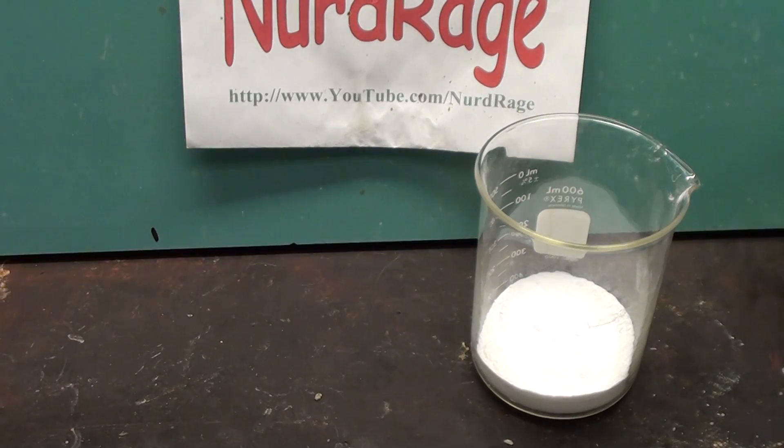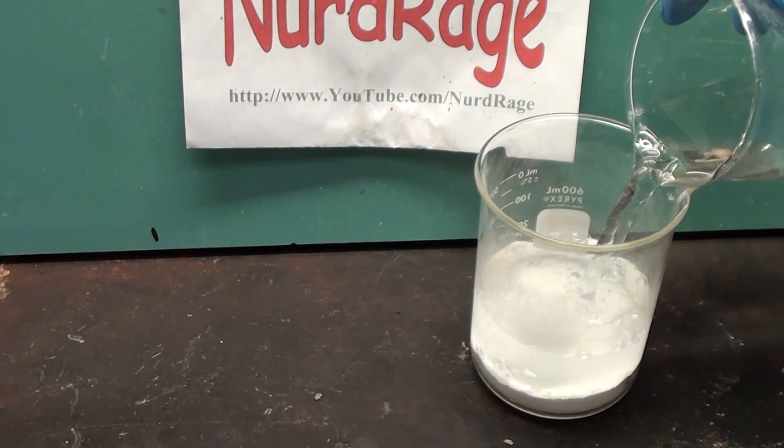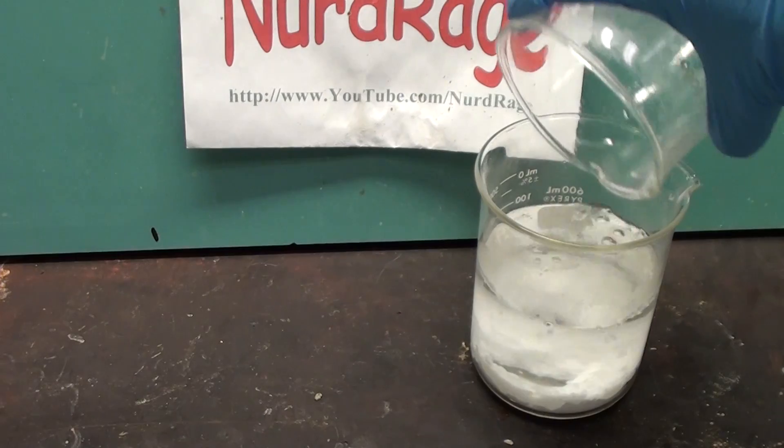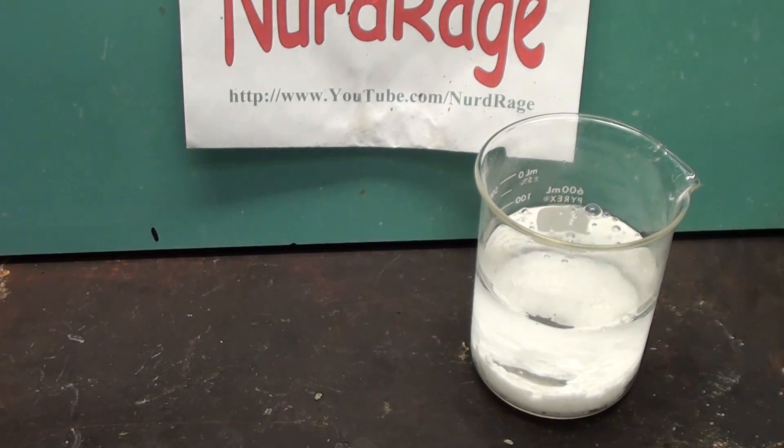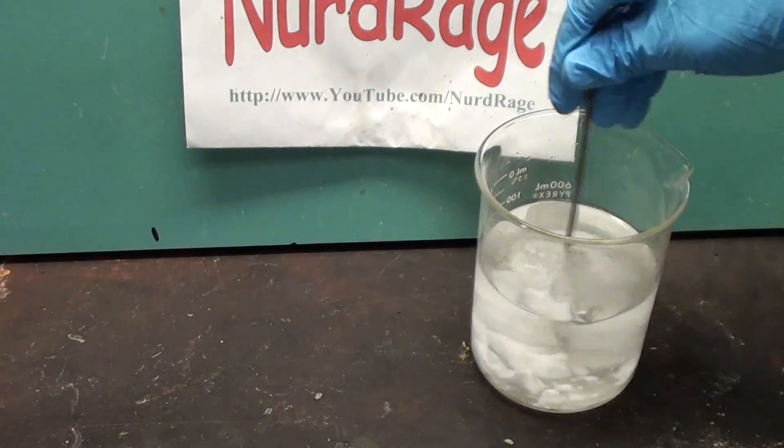First we get ourselves a solution of sodium bicarbonate. I have here 200g of sodium bicarbonate and 400mL of water. I'm just being very crude here and it's not going to all dissolve.